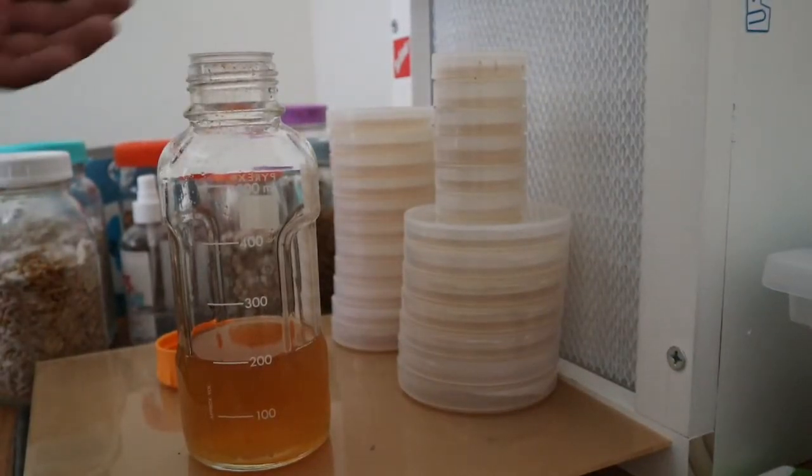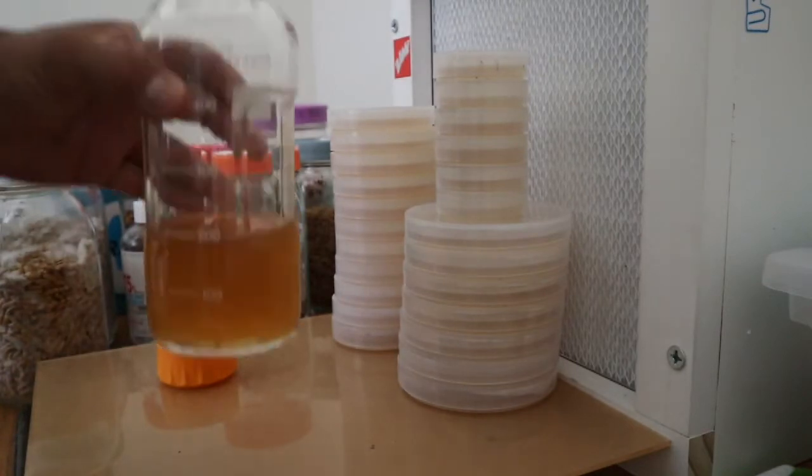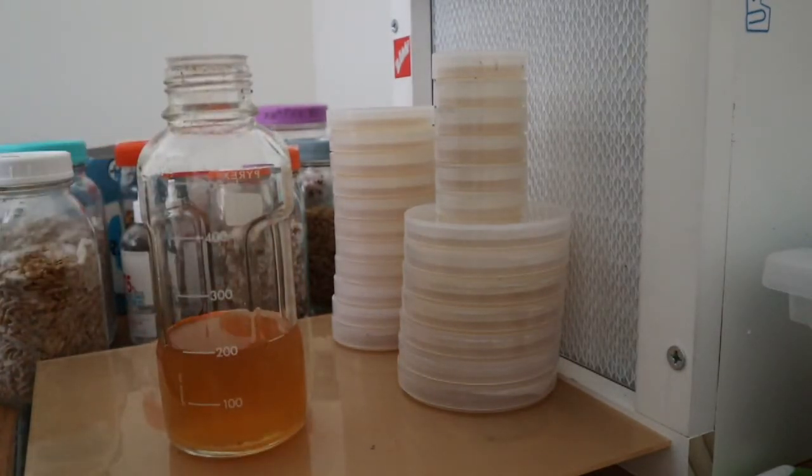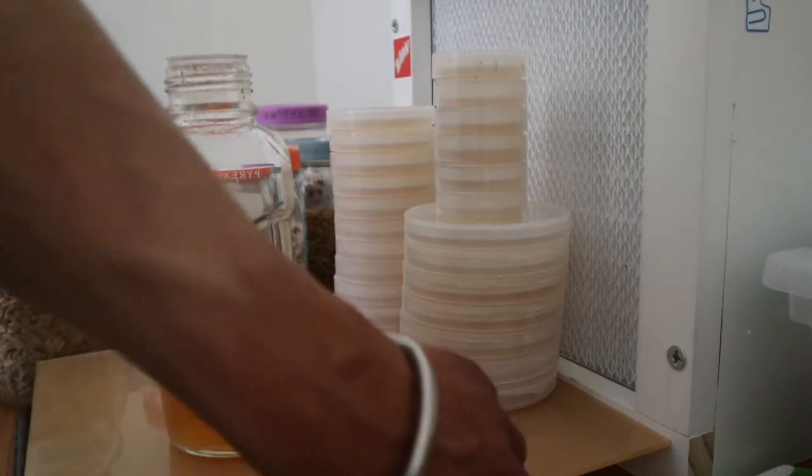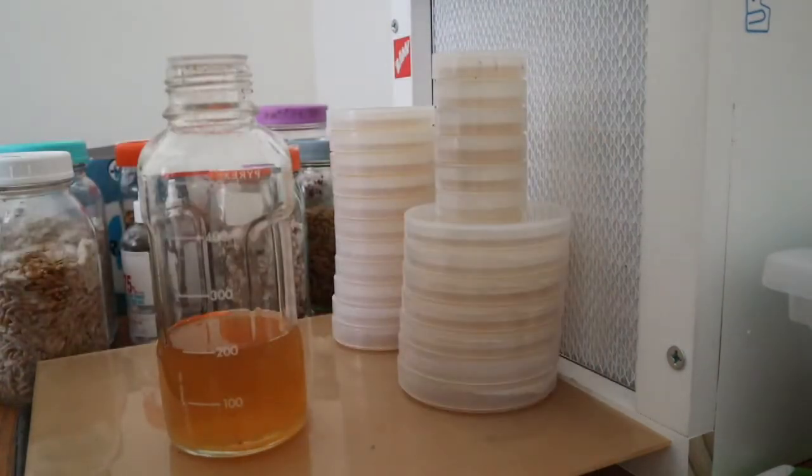Alright everyone, so we're basically done pouring up, and there's leftover agar around 200 milliliters. That's gonna go bad and gonna go to waste, unfortunately. It's kind of sad. Yes, I know, but it is what it is. Alright, so from here, if I had more dishes, then it wouldn't go to waste, but that'll be the end of the video, guys.